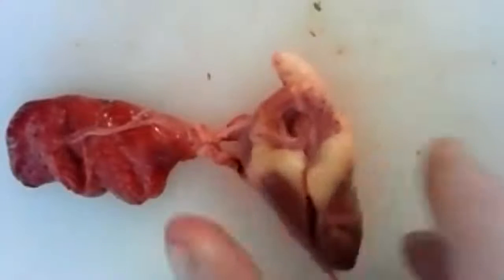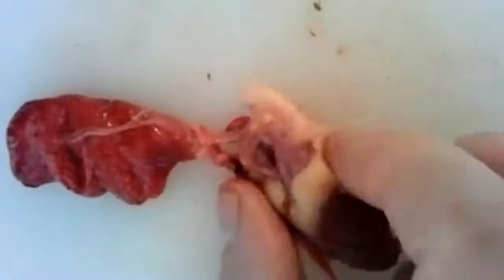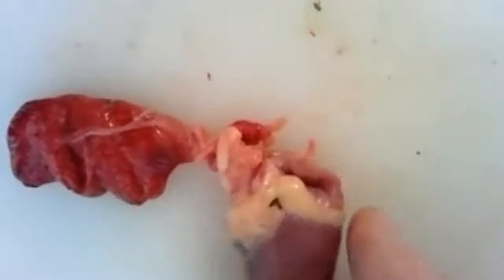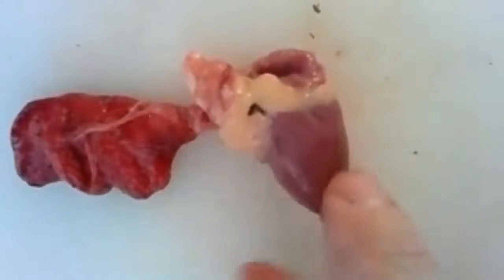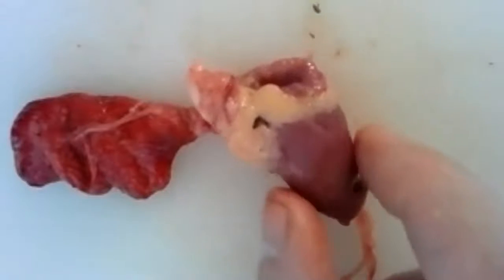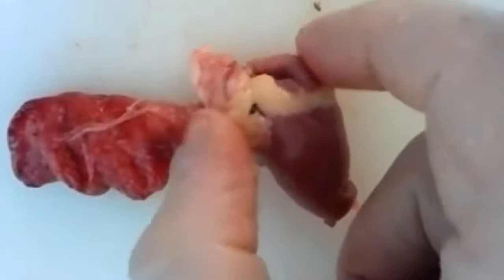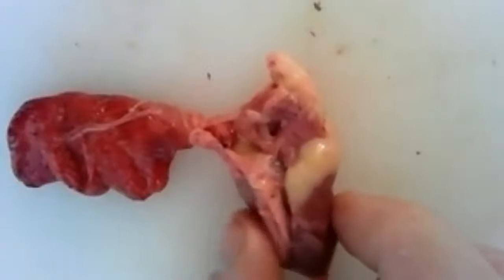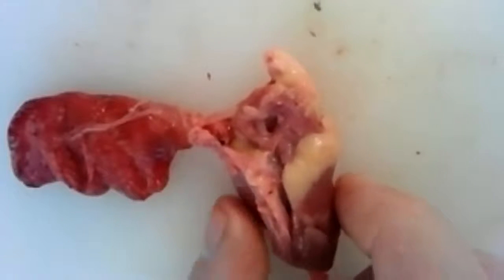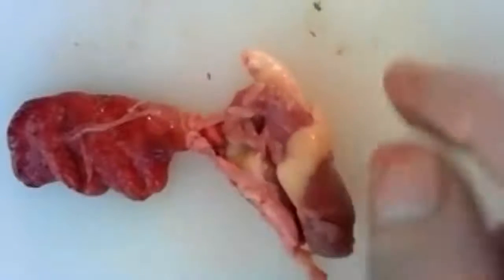So here's our heart. I cut a little slice in it so we can see inside. This heart is shaped a lot like our heart. Okay, we have these large muscly portions on the bottom here. Those are called the ventricles. There's much smaller ones up here. They're called the atria, and they kind of help, but the power all comes from the ventricles. That's where they squeeze and they squirt that blood right out of those tubes.